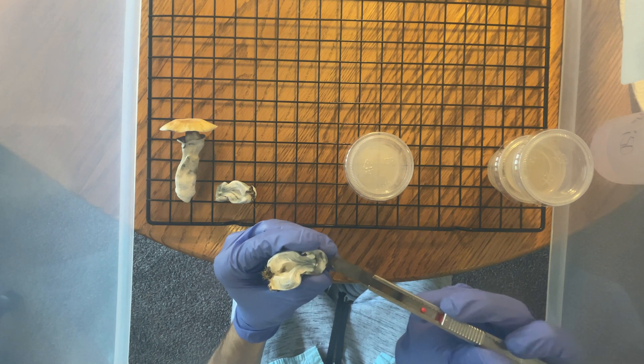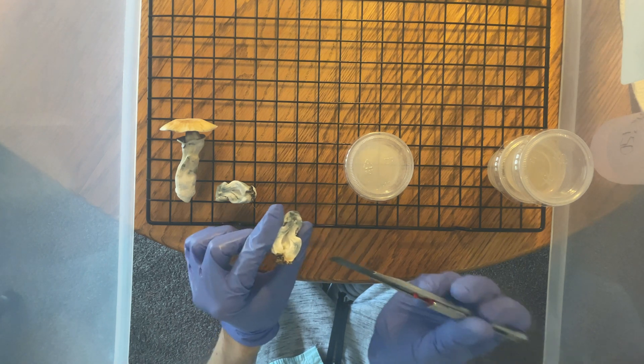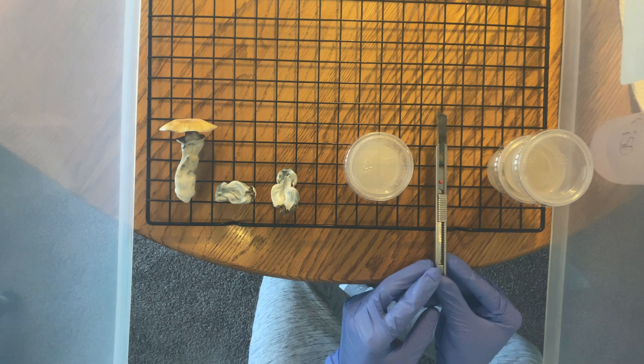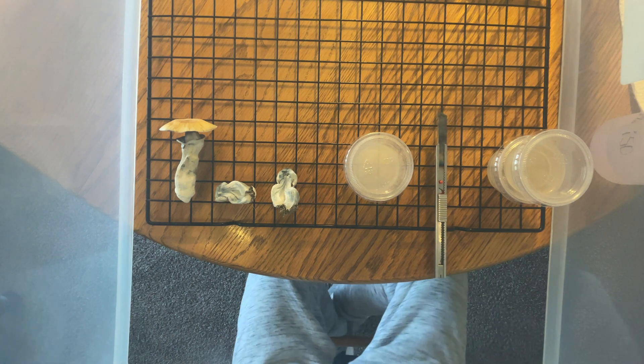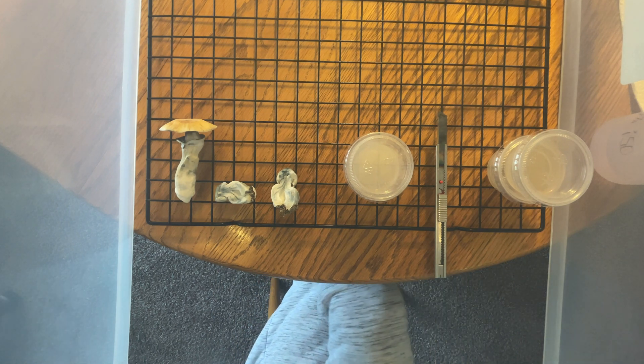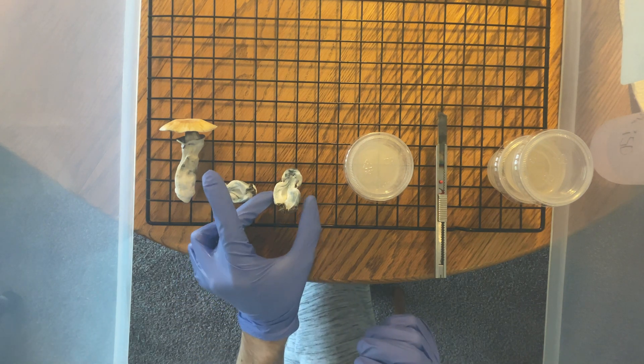Now, I accidentally touched my blade on my finger during that clone attempt, so I had to put everything down in order to re-flame sterilize my blade. After the blade had cooled, the transfer I was working on had fallen off the mushroom itself as I picked it up. Oh well, I just cut out a new transfer and got on with my day. No sweat.